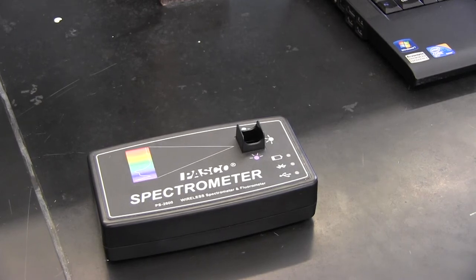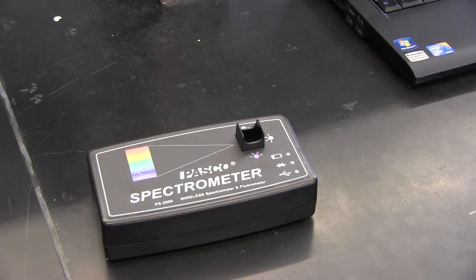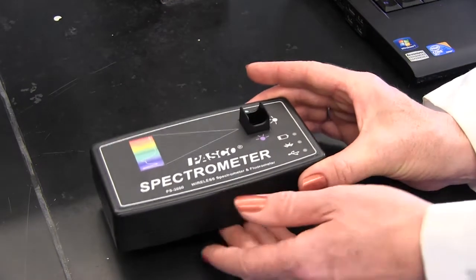Welcome to this video tutorial to show you how to use the PASCO wireless spectrometer with the fiber optic probe. This is the spectrometer.